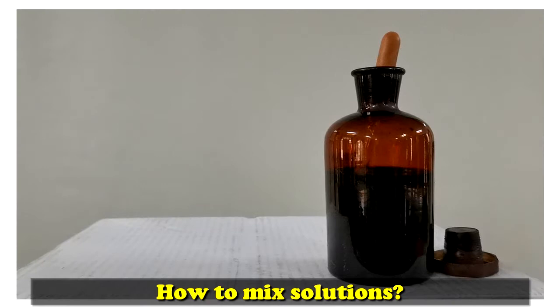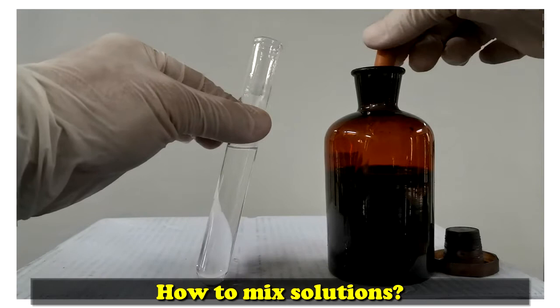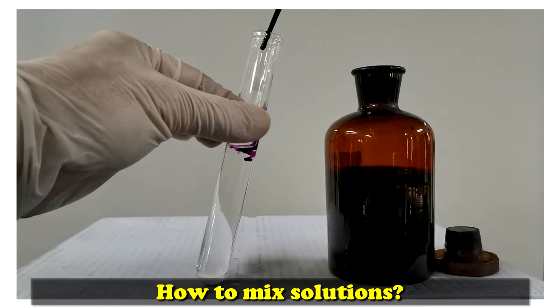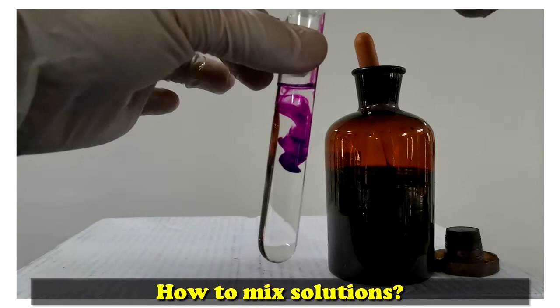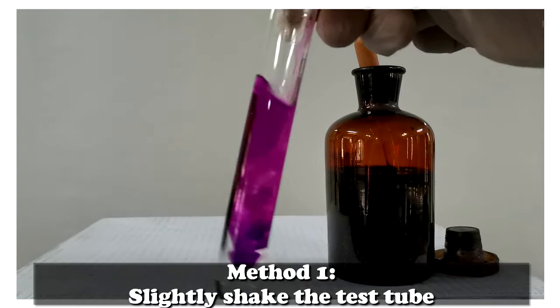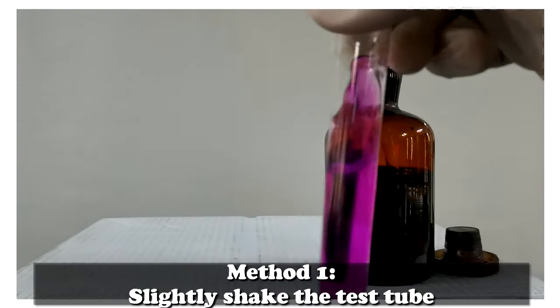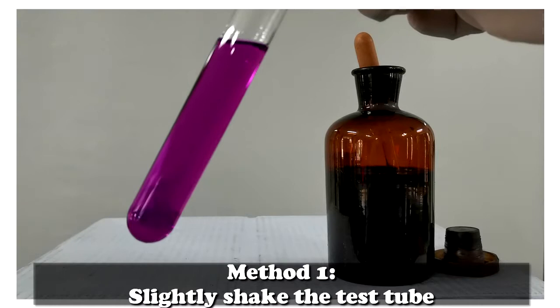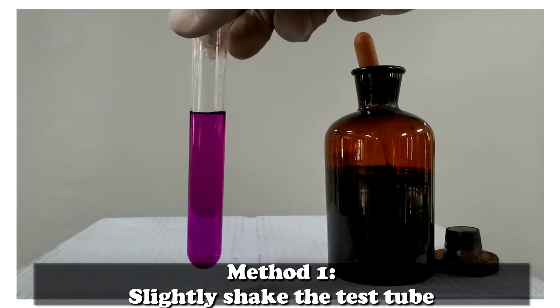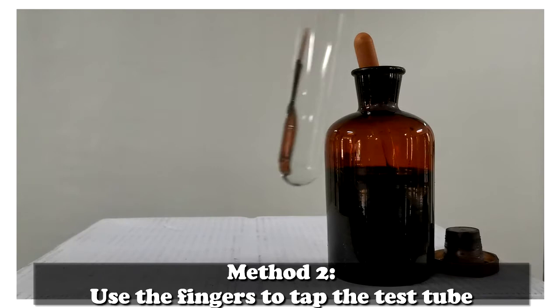How to mix a solution. Method 1: Slightly shake the test tubes. Method 2: Use the fingers to tap the test tubes.